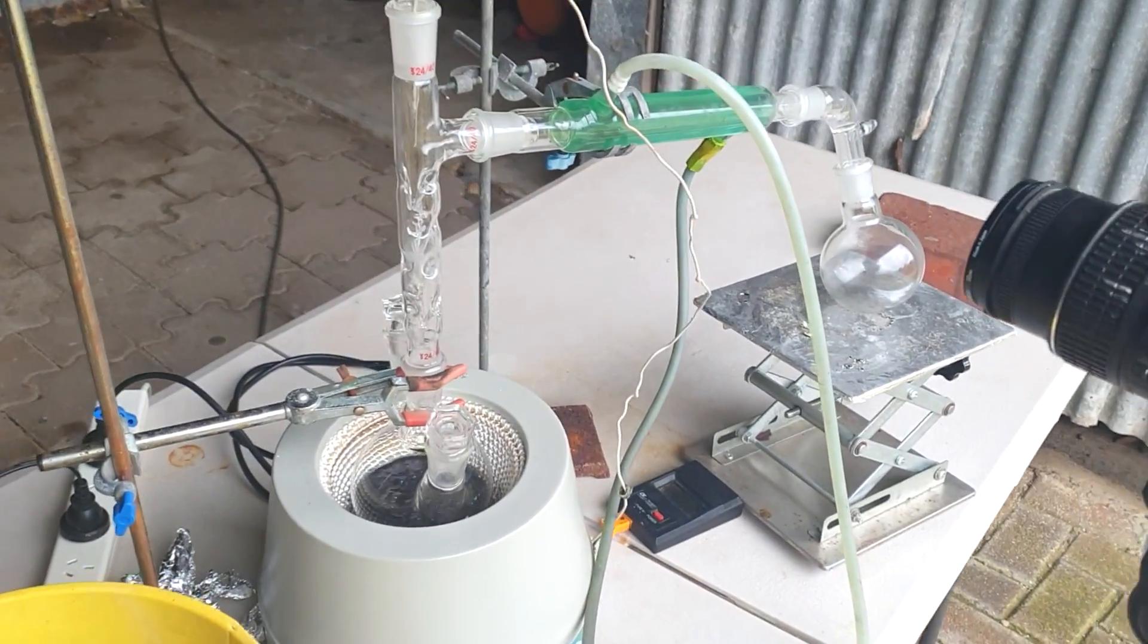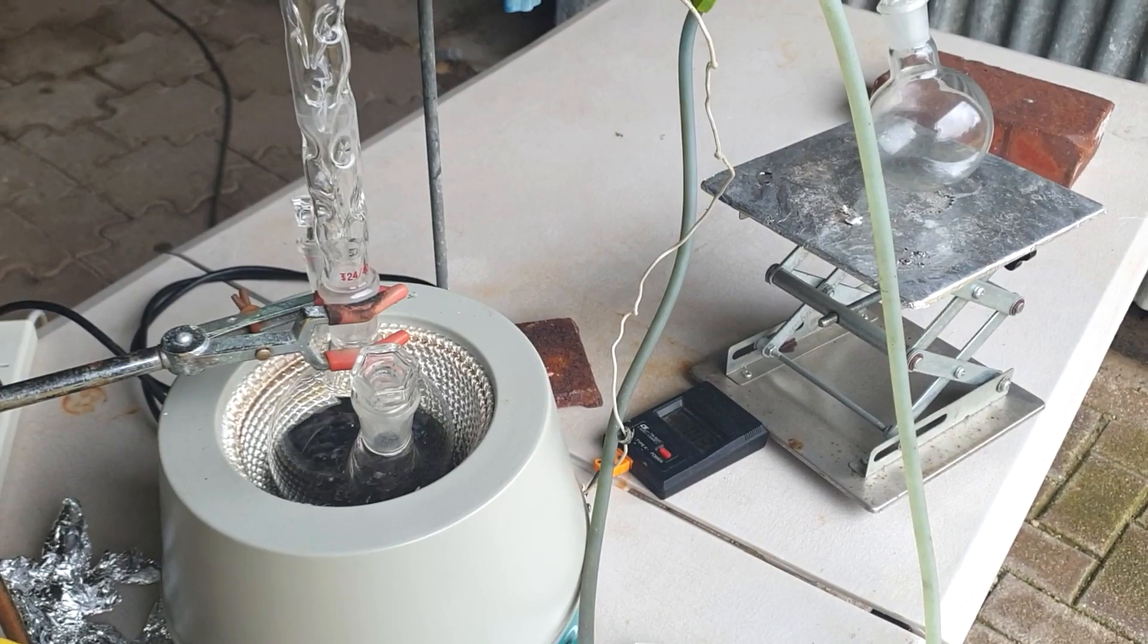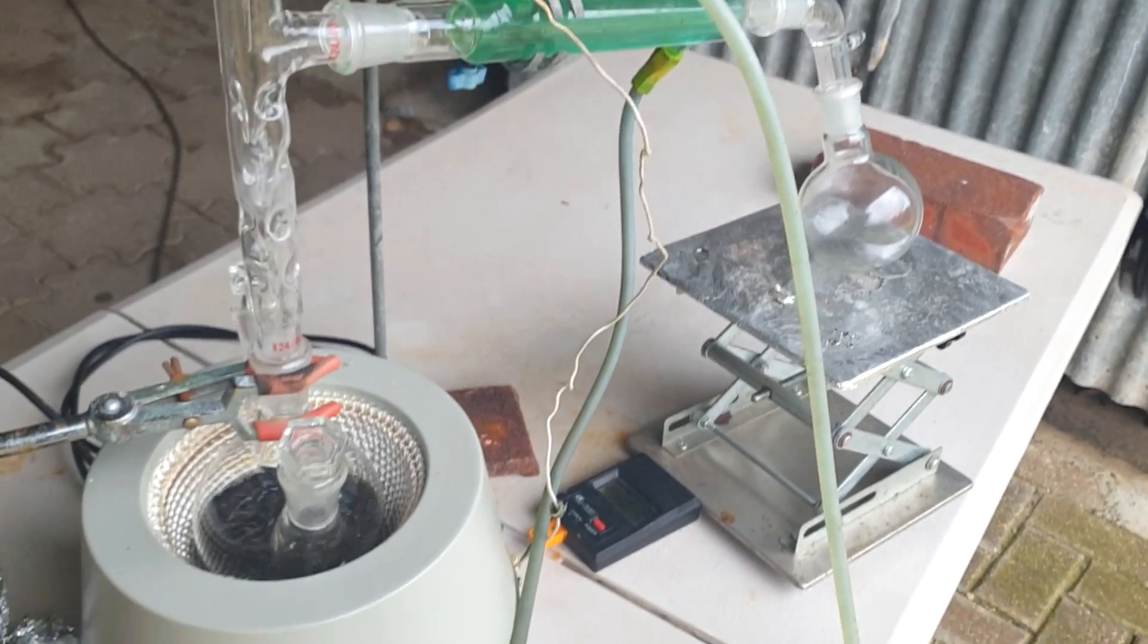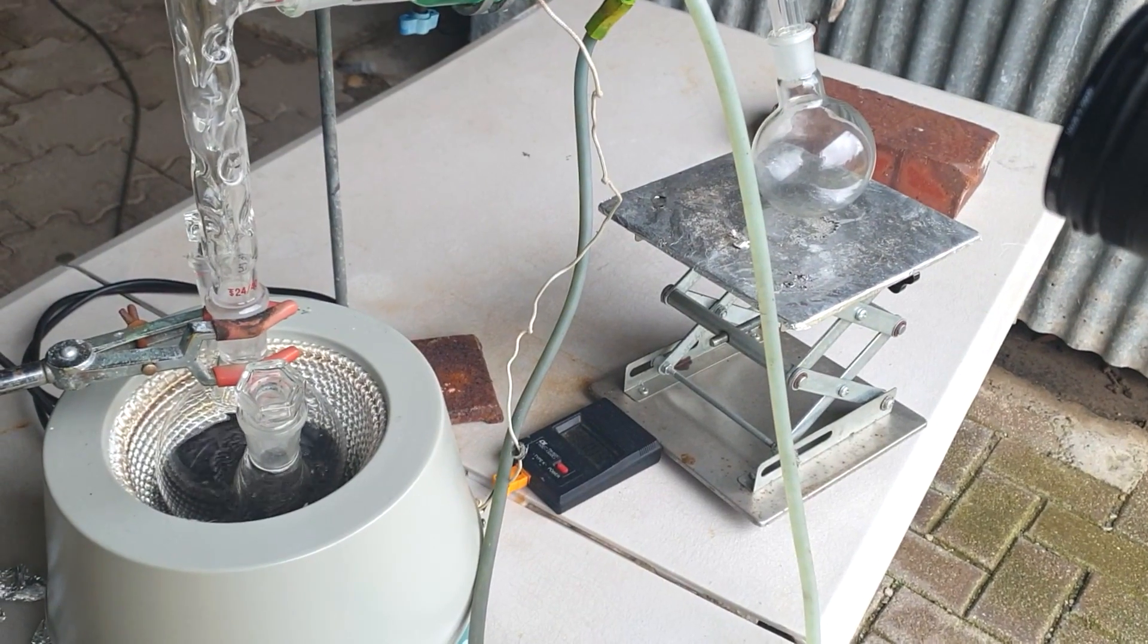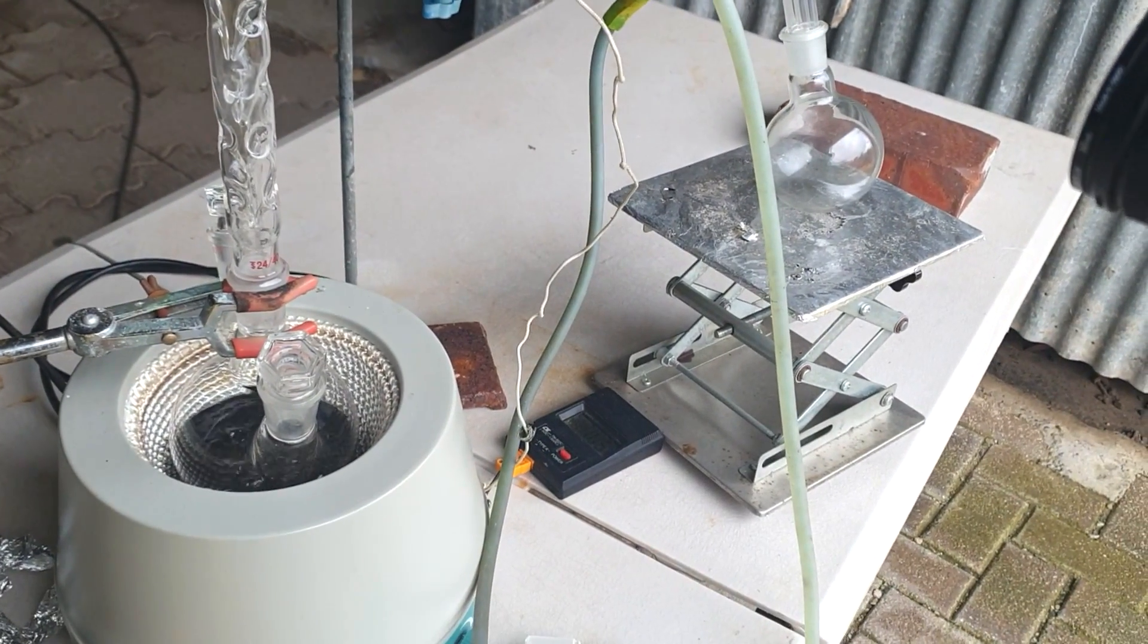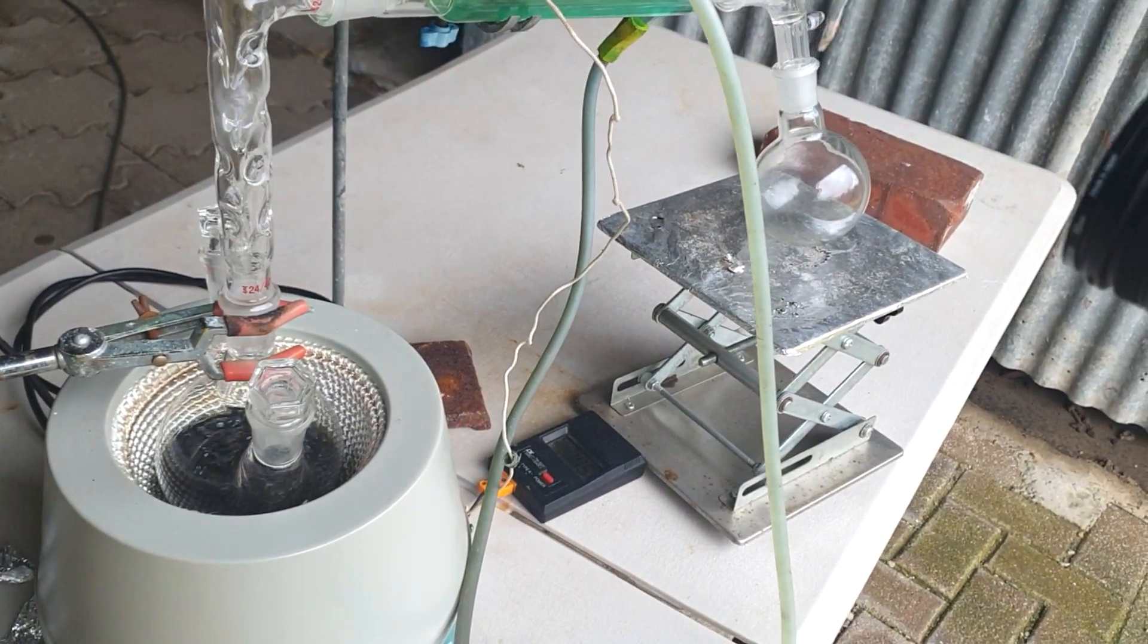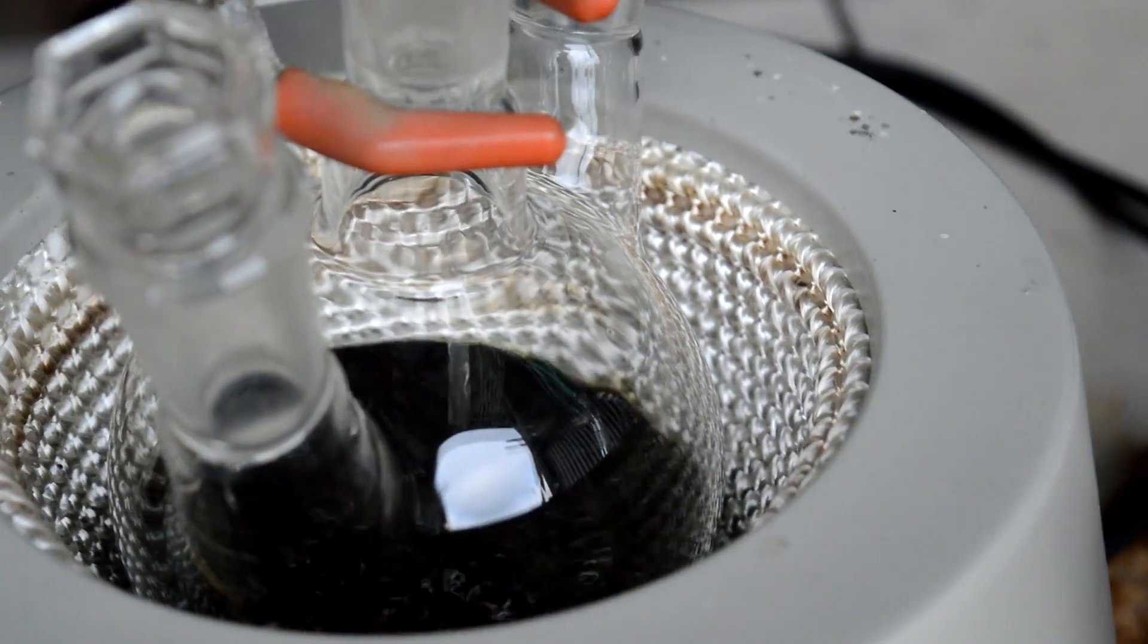I've quickly set this up for distillation and realized I've forgotten the entire step. There's a step after the Dean-Stark where it's neutralized so there's no more sulfuric acid. What do I do at this point? It was fine refluxing before, so I'm just going to let it go. Maybe it's to stop dioxane formation now, but we're just going to take off a little solvent and then leave that for neutralization. The rest of the toluene we can get rid of during vacuum distillation. We'll just remove the bulk of the solvent without trying to boil it dry.